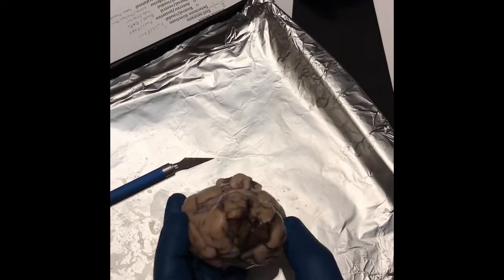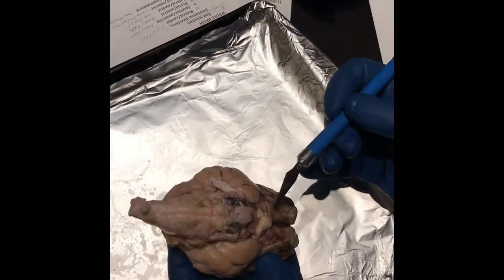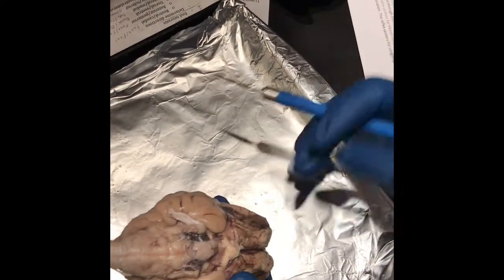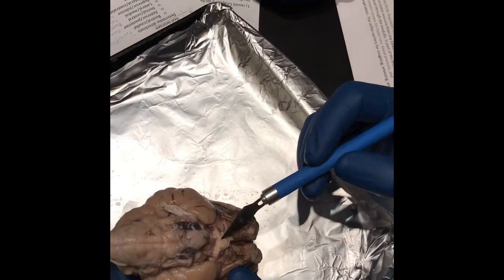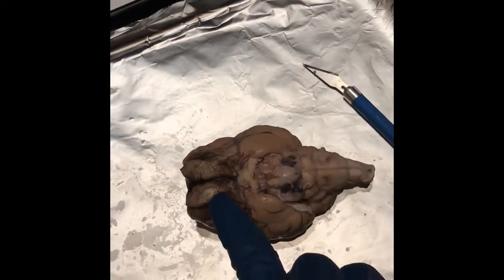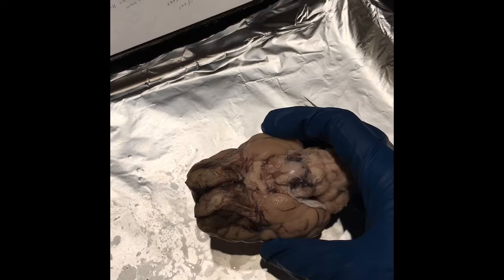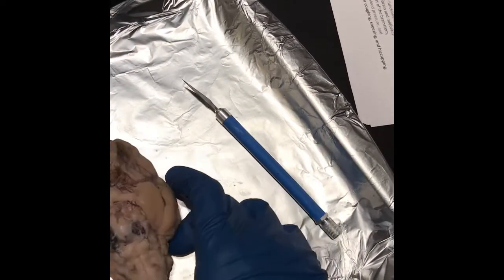Then, looking for the optic chiasm, which is that guy right there. You see where the optic nerve comes through, and then the eyes would be big right here. The optic chiasm is for the crossover of visual information from the eyes and the optic nerves. And then these are the olfactory bulbs, which are very large on a sheep because smell is a good thing to have if you're a sheep. The primary sensory organ is the smell.